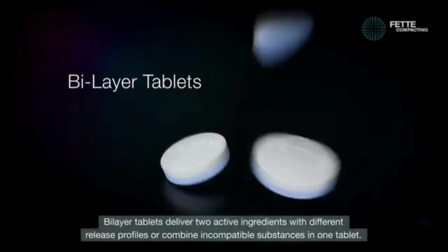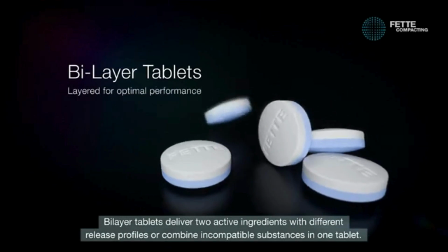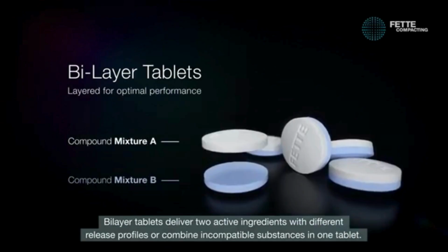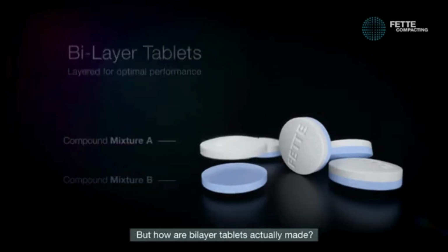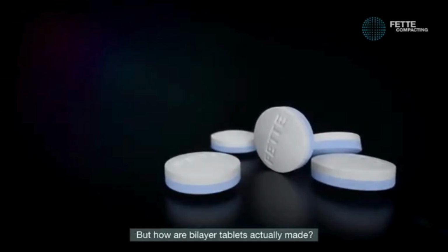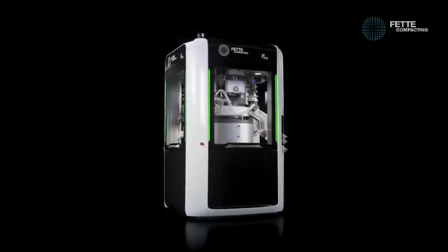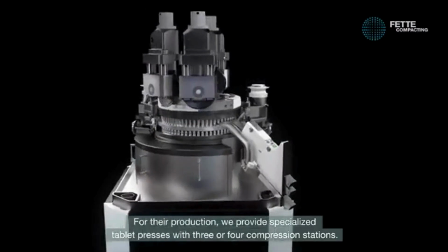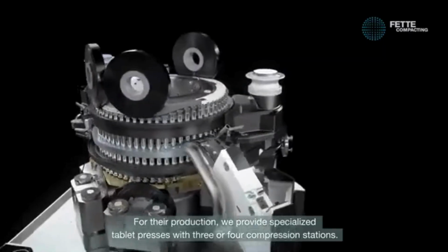Bilayer tablets deliver two active ingredients with different release profiles or combine incompatible substances in one tablet. But how are bilayer tablets actually made? For their production, we provide specialized tablet presses with 3 or 4 compression stations.